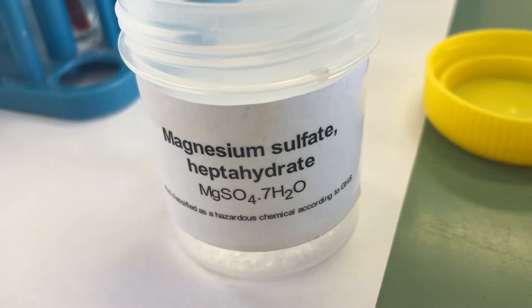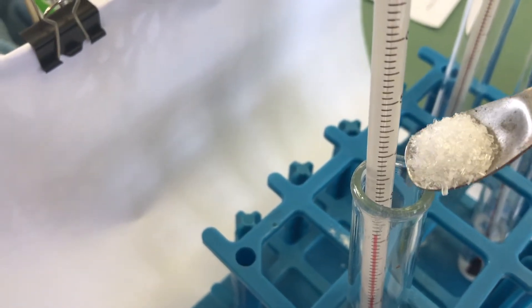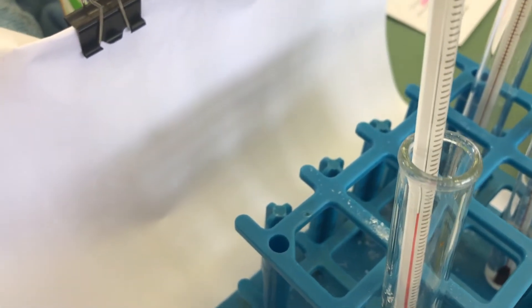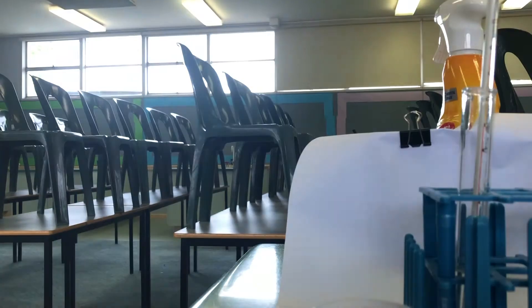Our next one is magnesium sulfate — quite a sparkly looking substance, quite nice. Let's get some here, put it down into there, put my frame down.